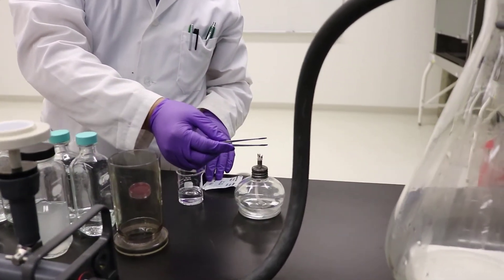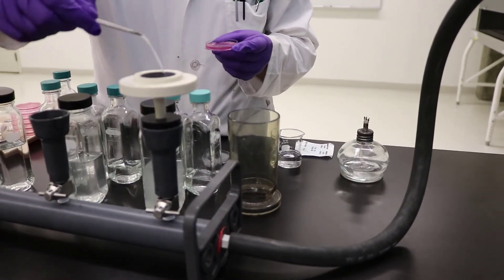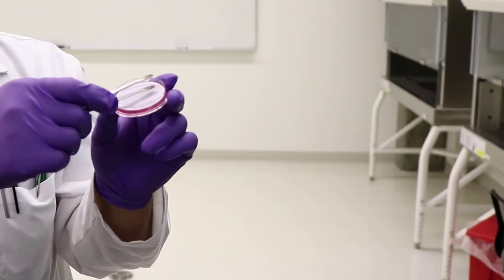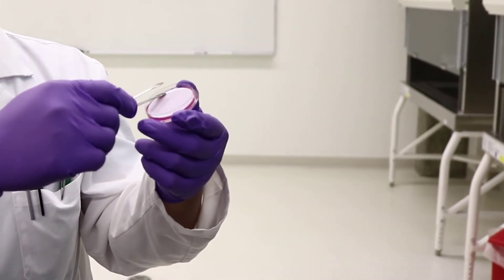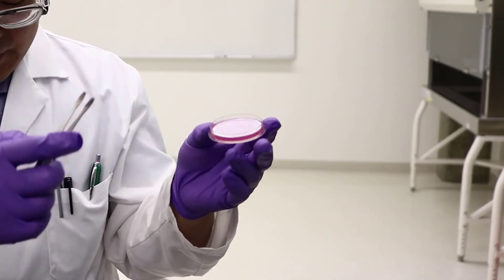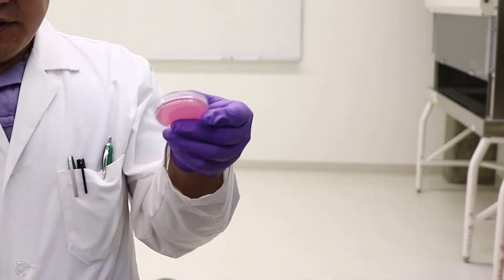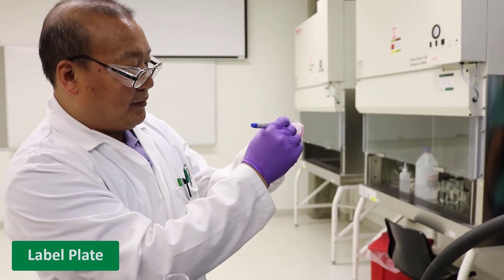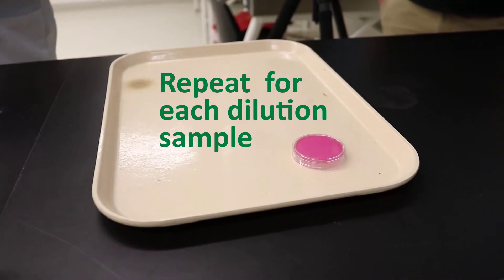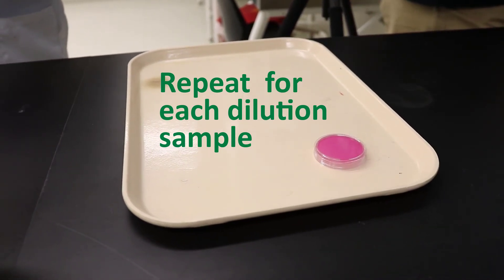Sterilize the forceps once again and use them to take the filter membrane from the filter unit. Place it carefully on the agar plate, grid side facing up. Carefully use the forceps to press the membrane into place in the dish to make sure the whole membrane touches the agar with no gap in between. Label a plate with the sample name, dilution, and group ID on the bottom. You will need to repeat this process and make 2 plates for each dilution sample.